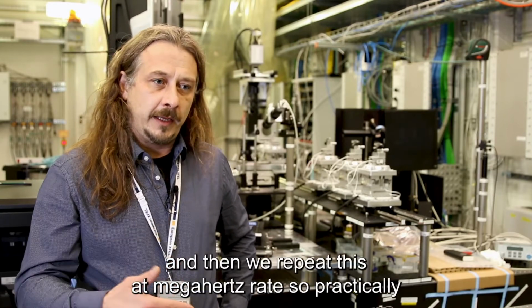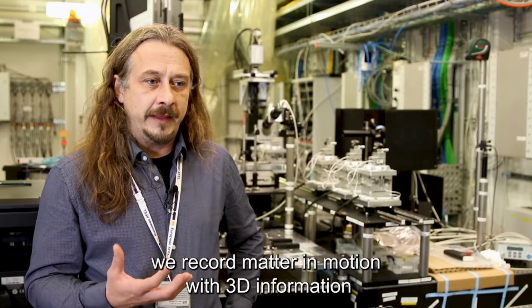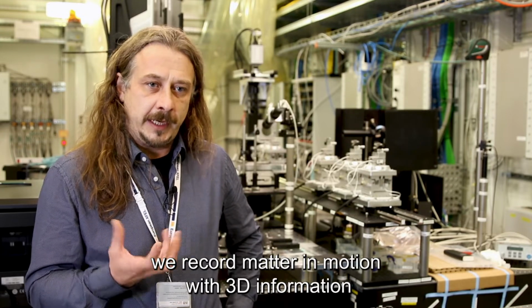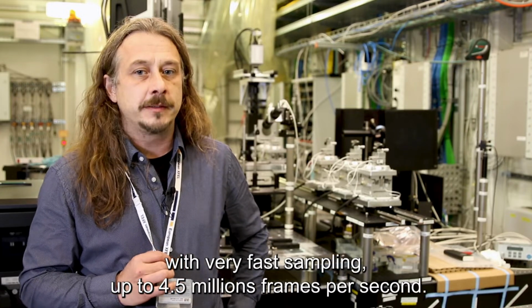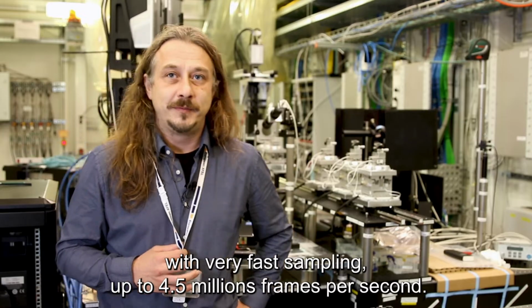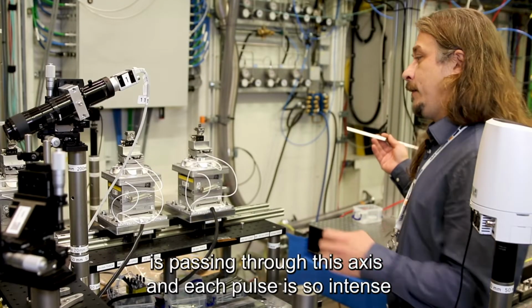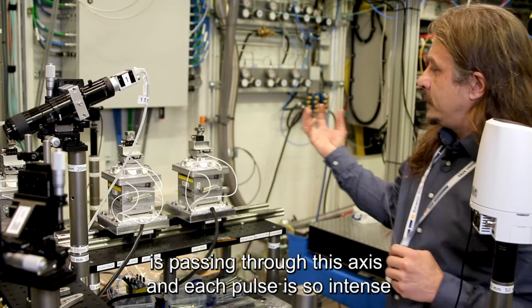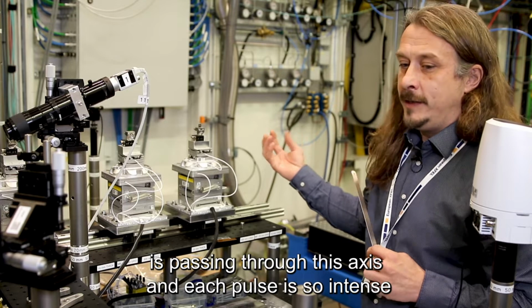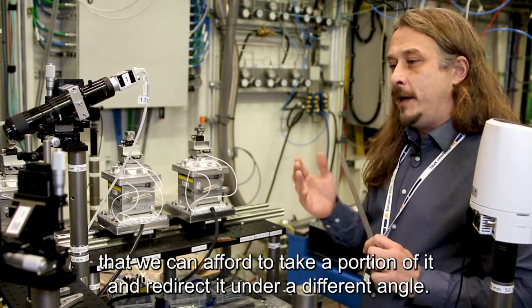And then we repeat this at megahertz rate. So practically we record matter in motion with 3D information with very fast sampling, up to 4.5 million frames per second. The X-ray beam from the machine is passing through this axis, and each pulse is so intense that we can afford to take a portion of it and redirect it under a different angle.